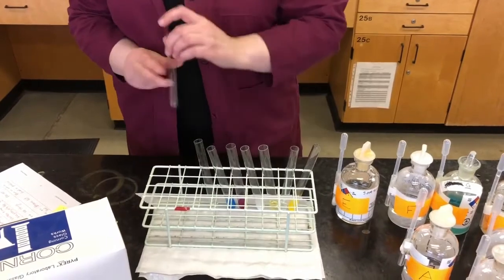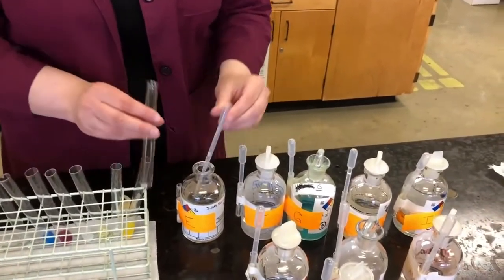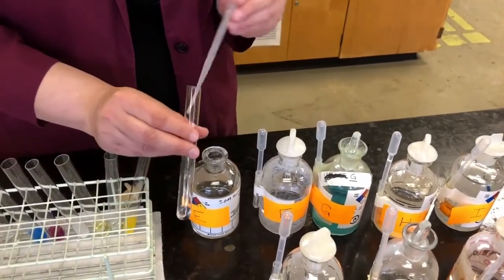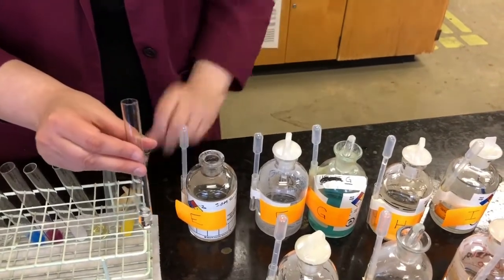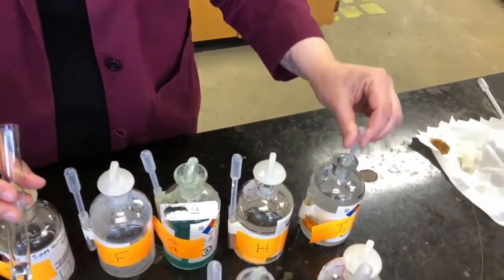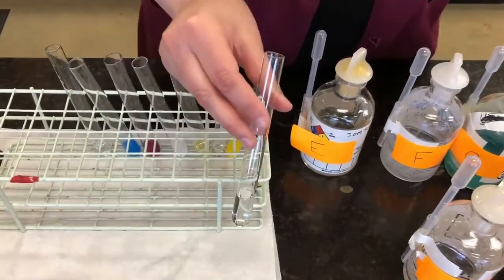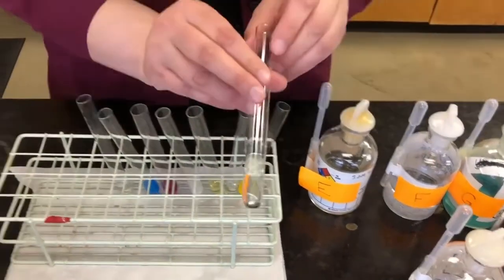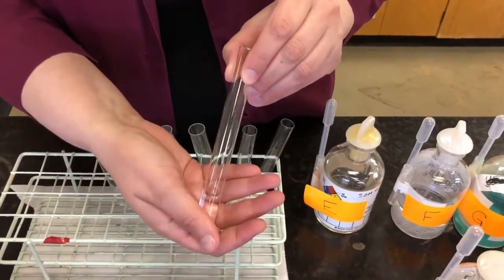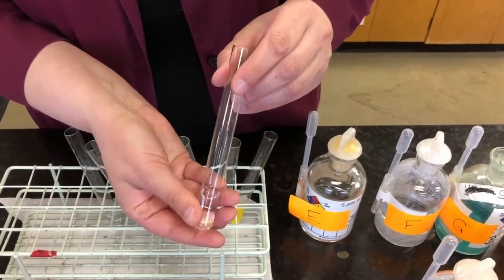And finally, we have E plus I. So E again, clear colorless. That wasn't quite a milliliter, let's get a little bit more. And I, also clear colorless. And in this case, we don't actually see anything. We don't see a color change or bubbles, but if I feel the test tube, it is actually getting warm. Okay, so as they react, it produces heat.